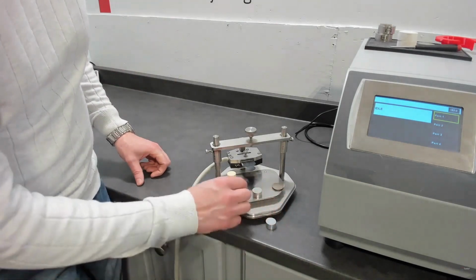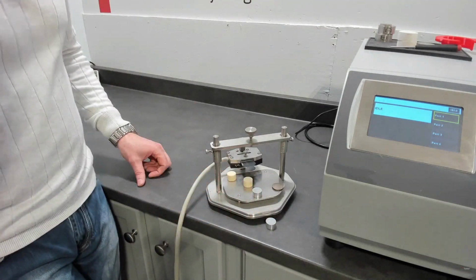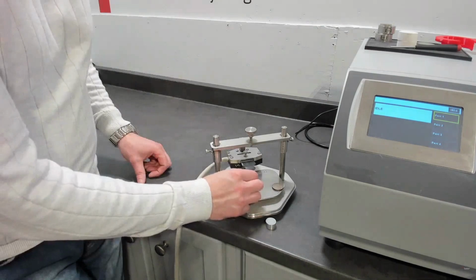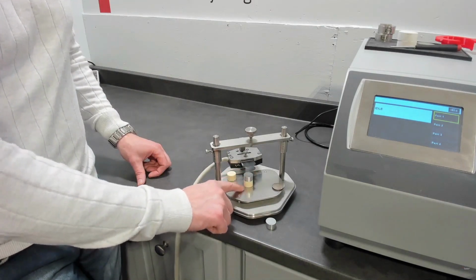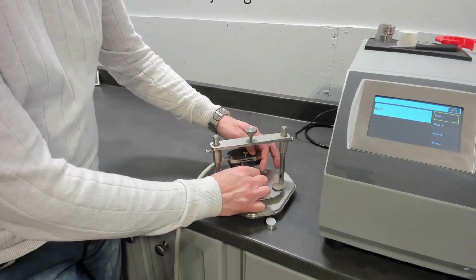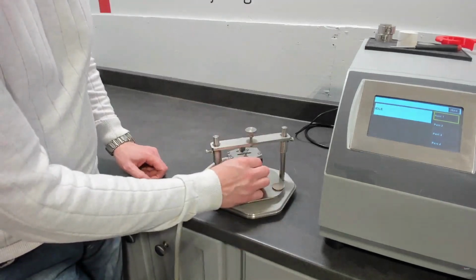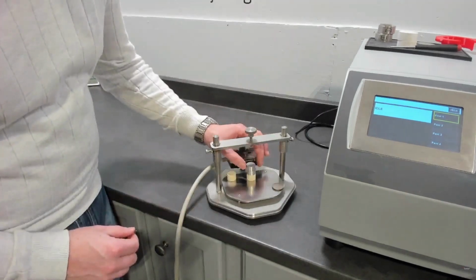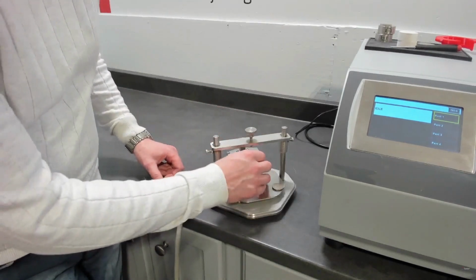So our sandwich would be, if we run this symmetric, and again, you can run this asymmetric or single-sided, but we're going to do symmetric, the bottom part is insulation and sample. Now you would, of course, measure the thickness of your sample. We've already done that. And then we would do a mirror on top. You would do your best to line up the sample with the diameter of the sensor.